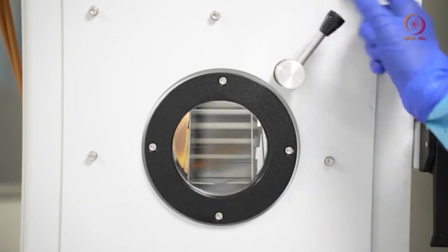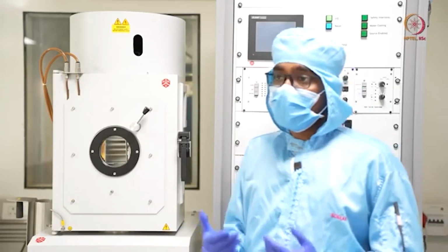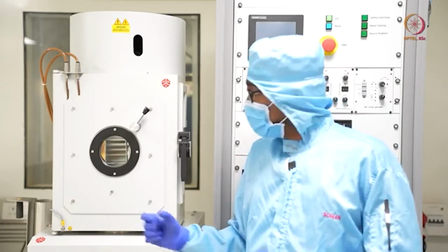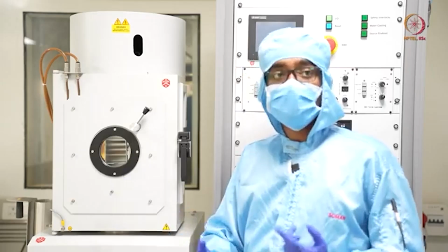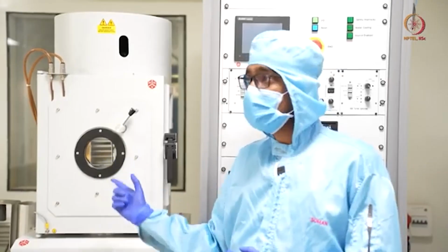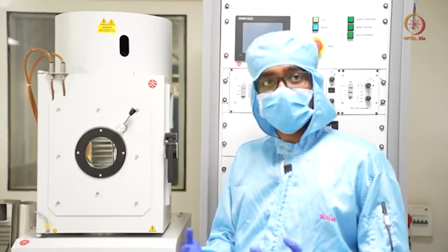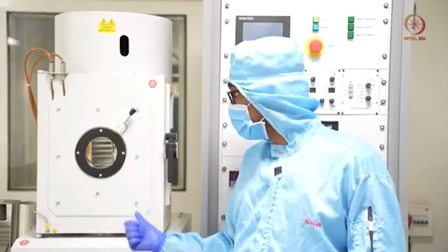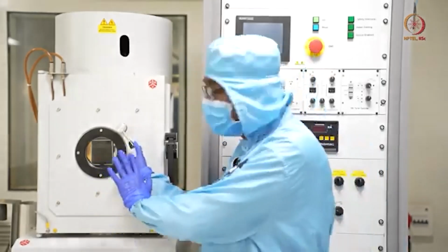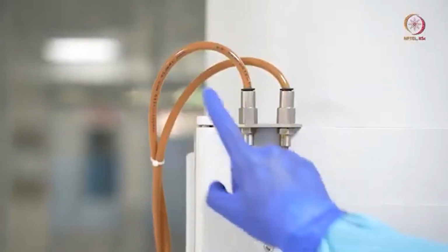Now the tool is off and there is no light source inside. When we do electron beam evaporation or deposition, we have one filament that generates light, so we can see what is going on inside. Even in the thermal evaporation system, the filament generates some light due to Joule heating, so we can see inside. But now the tool is off, so we cannot see. This is the viewport, so that we can observe the things inside.